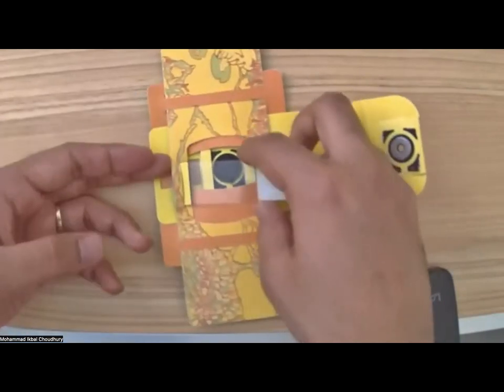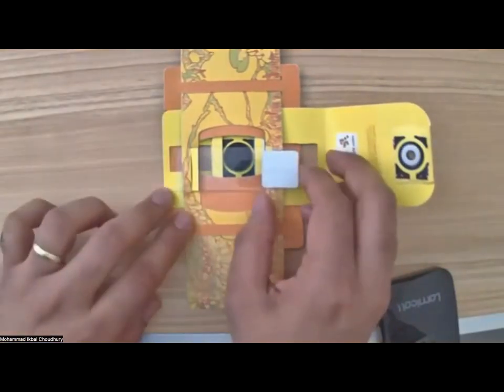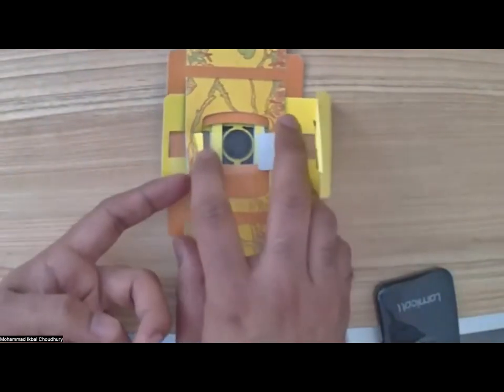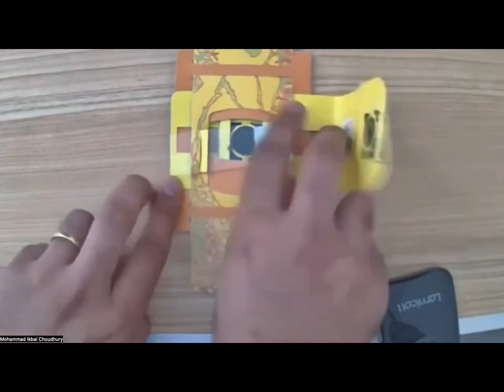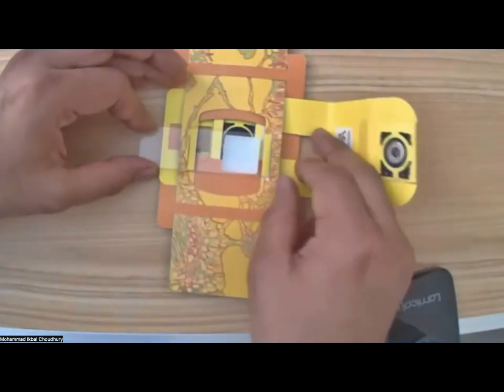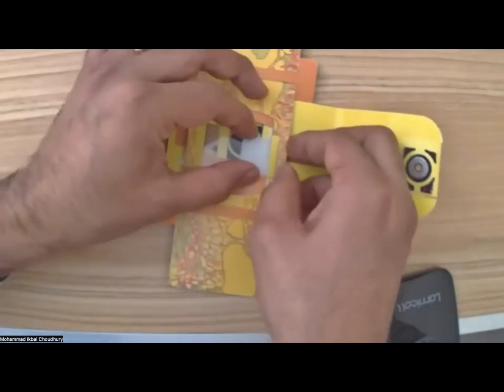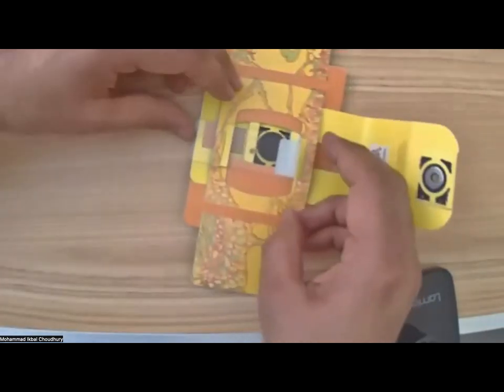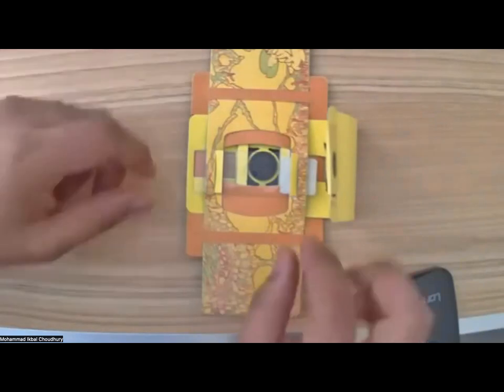This is going to be a little tight, where you are trying to push the glass slide into that small slit within the paper folds here. So you can slide it back and forth like that, right? You push it further like this, take this flap up, and then try to push the sample through the other side. You may start with an angle. The paper is a tough paper, so you will not break it. So feel free to play with it.